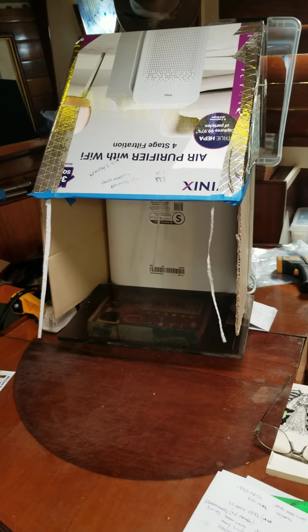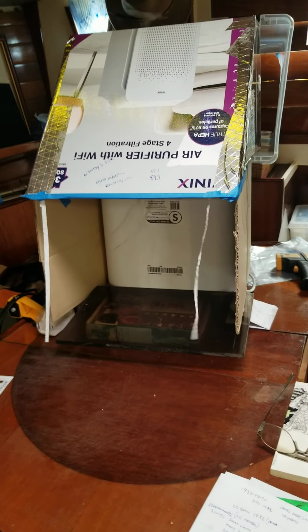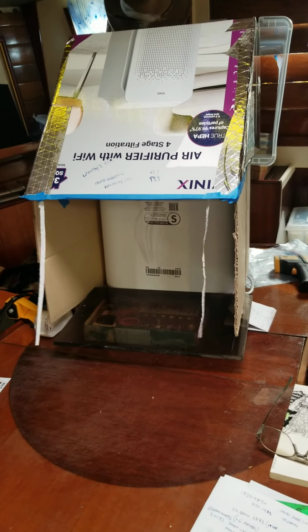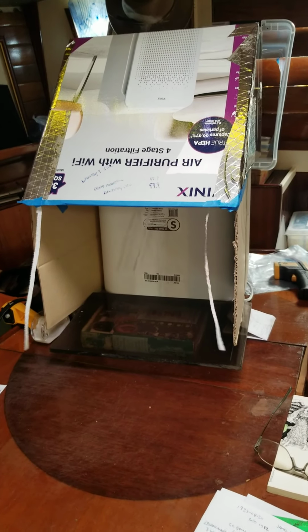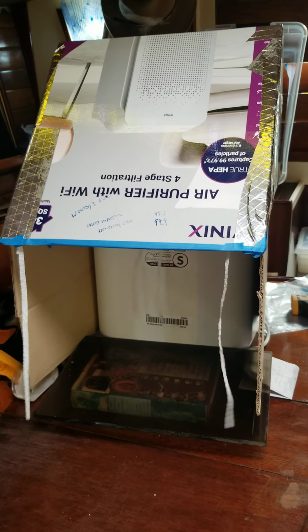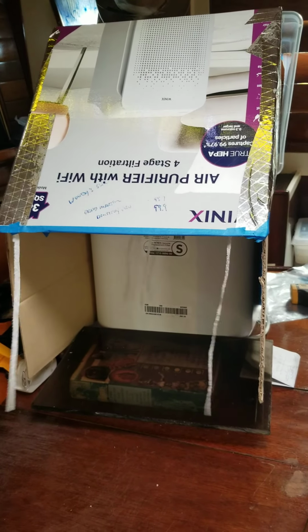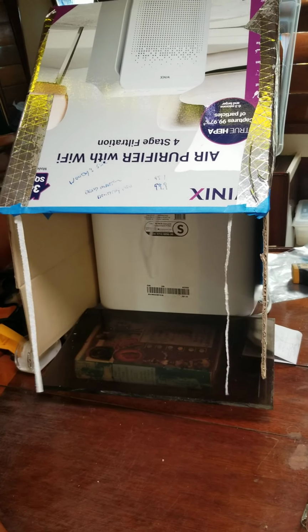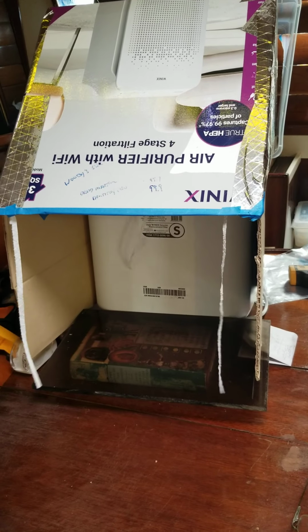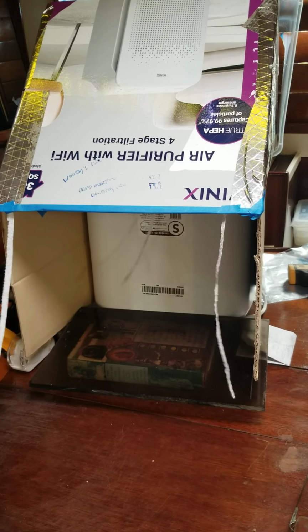At that point, you need to cut the bag open, take the nice hard lump of mycelium out, and mix it with clean rice. And I just did that in an open air setting, and I've got a lovely little culture going from what would have been spoiled bags that had trichoderma in them, and also yeast spoiled with bacteria.